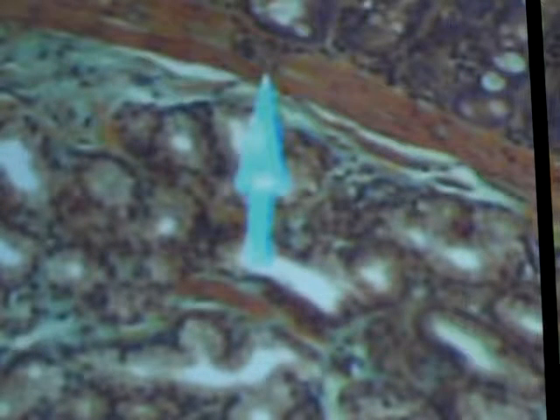And how do you differentiate the esophagus from the duodenum? The epithelium is going to be different. If you're seeing simple columnar, we know it's the duodenum. If you're seeing stratified squamous, then it's the esophagus. So you're looking for your Brunner's glands, which are in your submucosa.